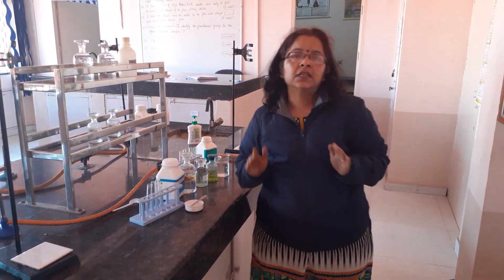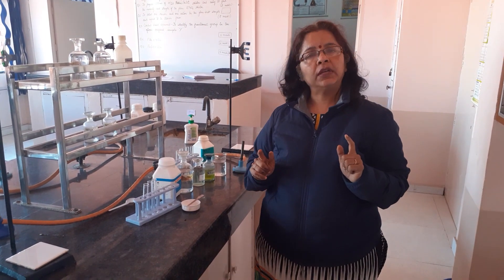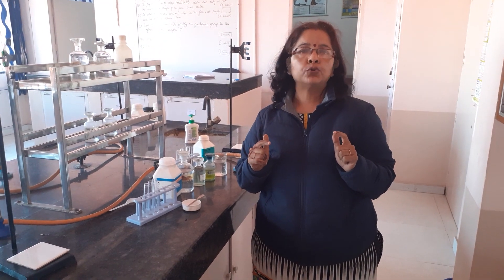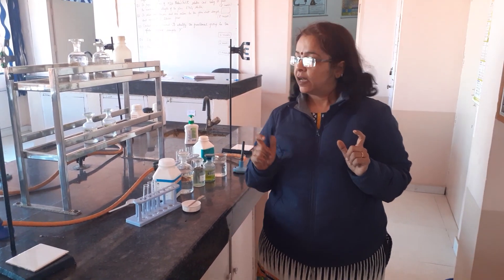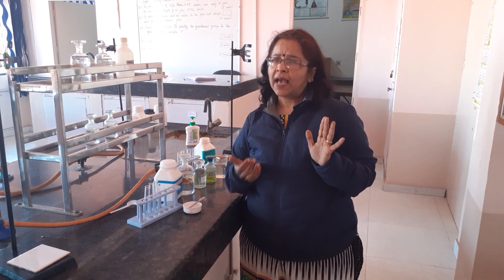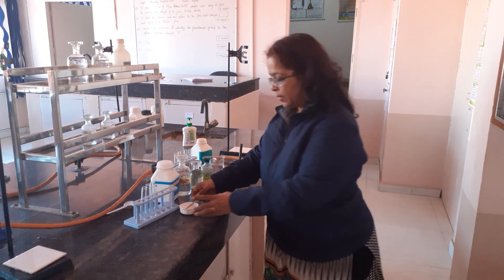A very good morning, students. In today's class I will be doing a shortcut route to find how to detect zinc ions. This is the practical which you do in class 11 as well as in class 12, and it's a high probability ion which is asked in your exams.